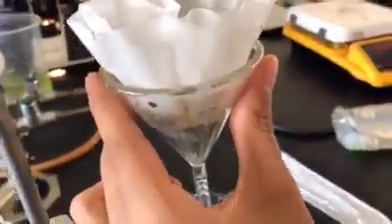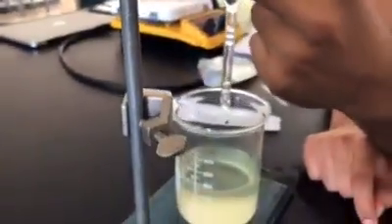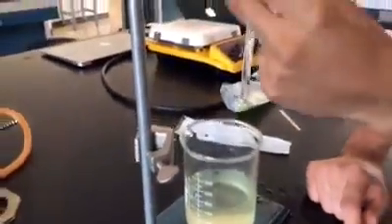Components present in this experiment were oil, CnH2n+2, and water, H2O. Here is a photo of our results. As you can see, there are still molecules of oil in the water. That's because our method is not 100% effective.